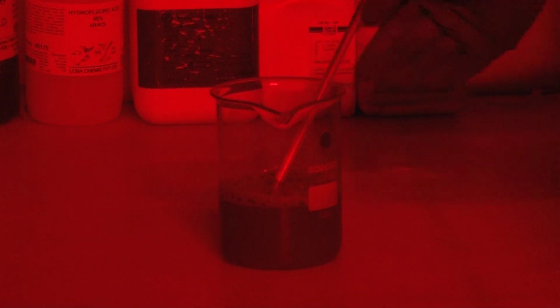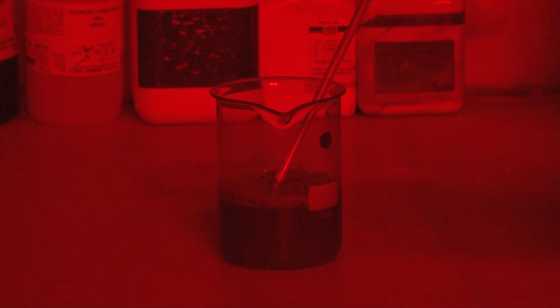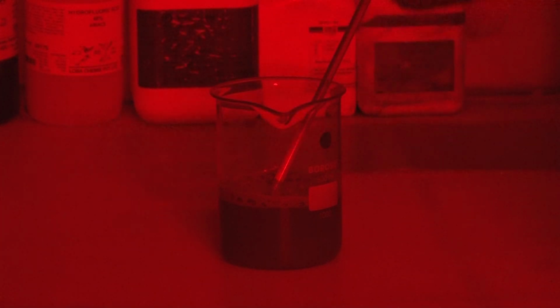We use distilled water because we don't want any kind of reaction, as HCl is already there. So we will wash out this sample with distilled water. You have to apply that procedure three or four times. You have to be sure that all the HCl has gone from the sample. Then you will apply another chemical processing step, which is hydrogen peroxide. The hydrogen peroxide will dissolve the organic part from the sample.